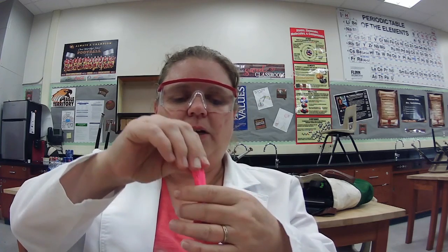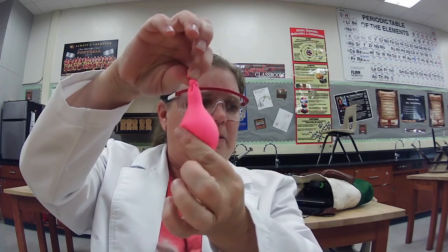Okay. So I've got my little bit of water there, and I'm just going to tie this off. So inside our balloon, think about what 2 things are in there. Definitely have some water, some liquid, but I also probably have something else because it's not all water. So I probably have some gases in there as well. So we've got this balloon done.